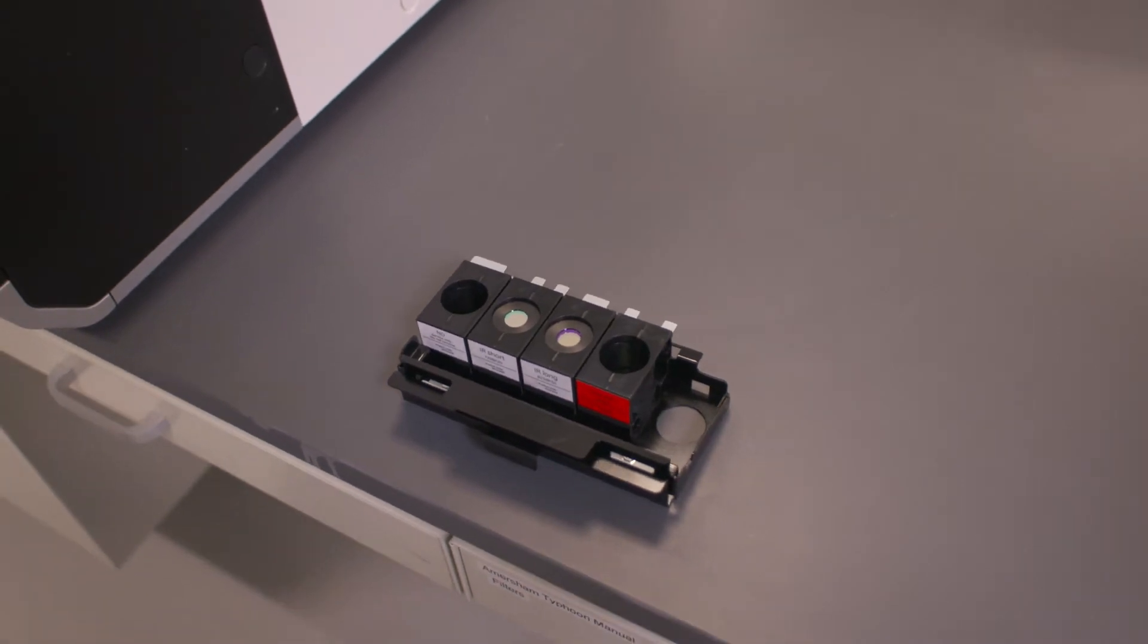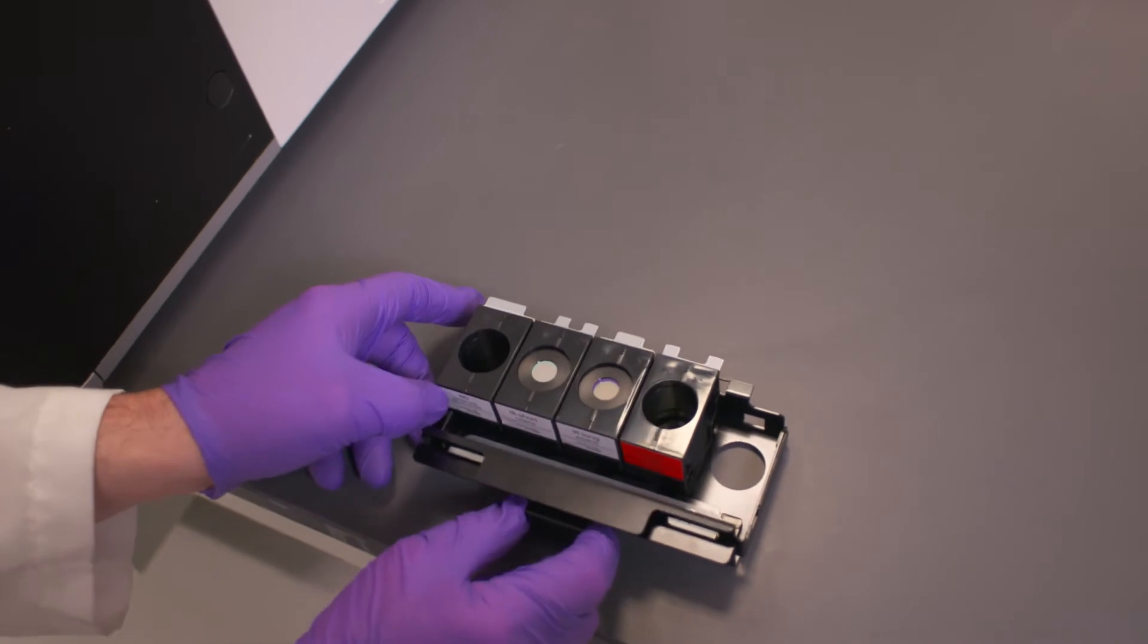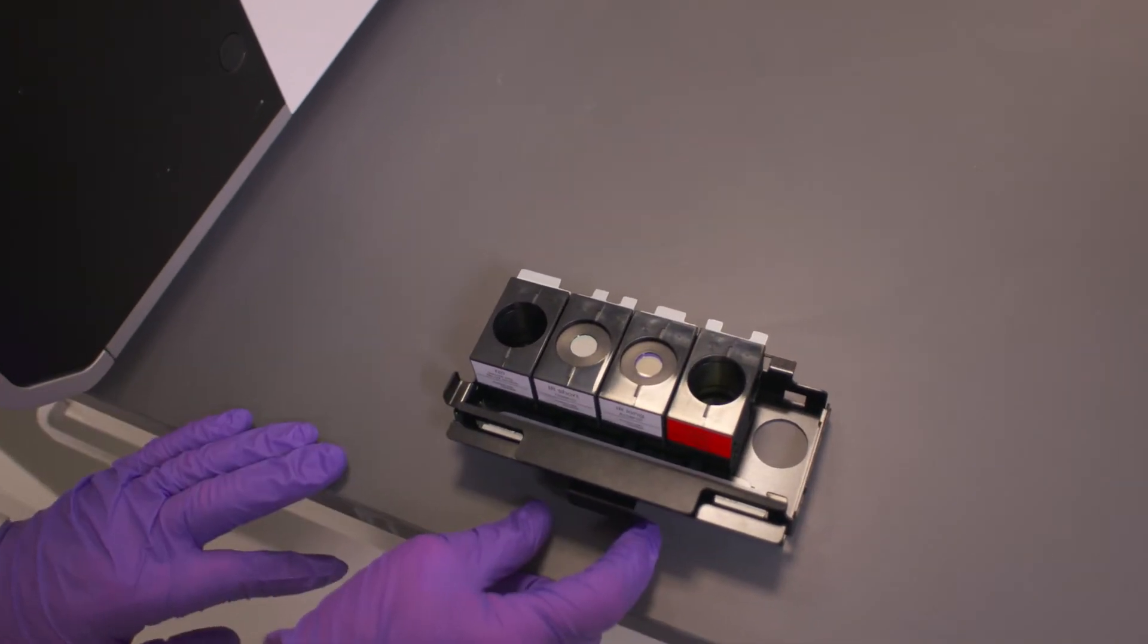Now it's enabled us to put a new filter into the system. We need to move this lever on the side here, so it just moves slightly to the left.